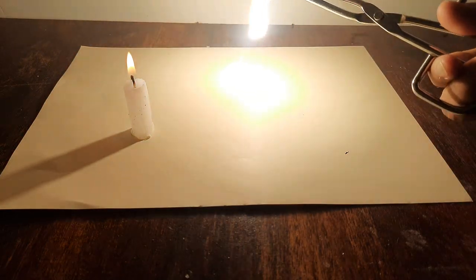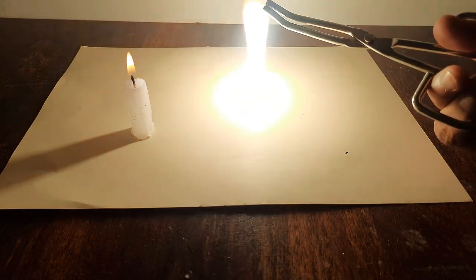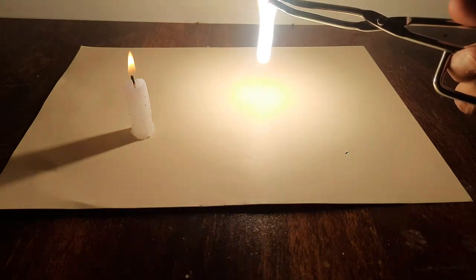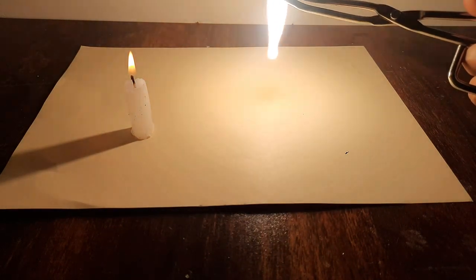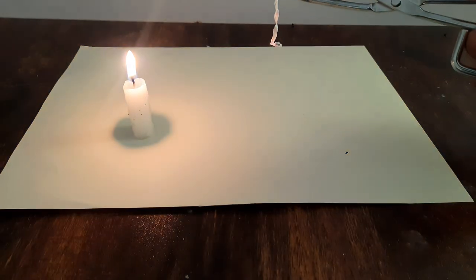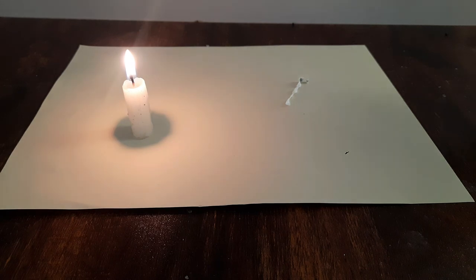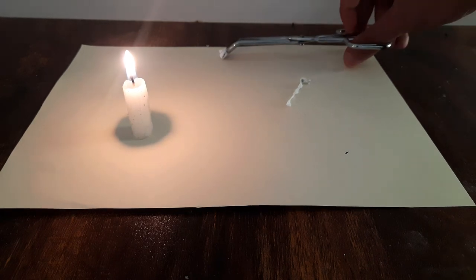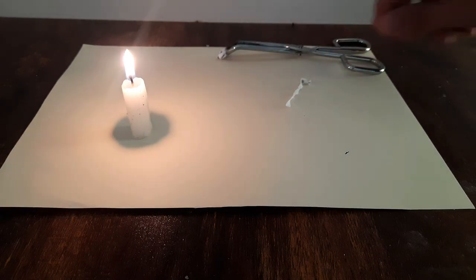Look at how bright the magnesium ribbon burns! The candle is not even visible. So what sort of a change was this? Was this a physical change or a chemical change?